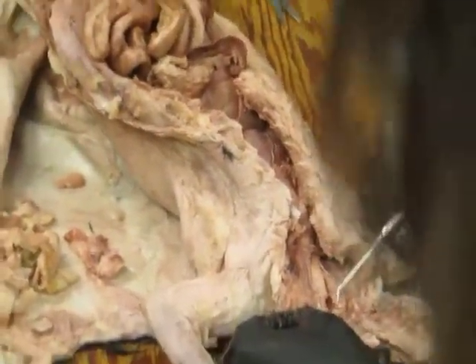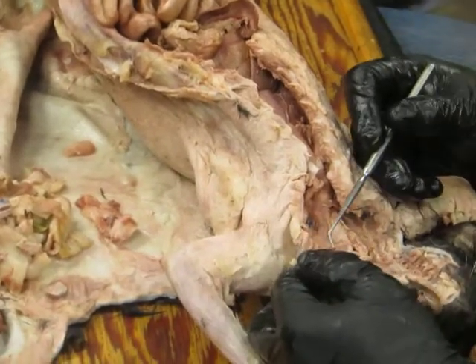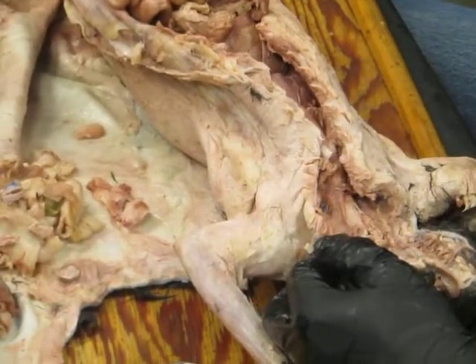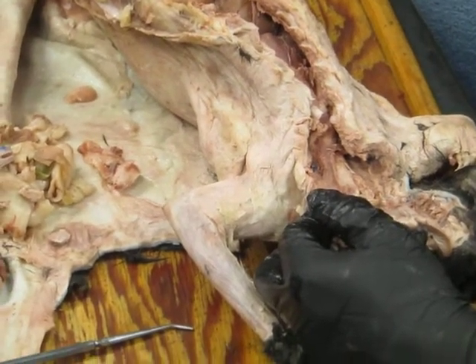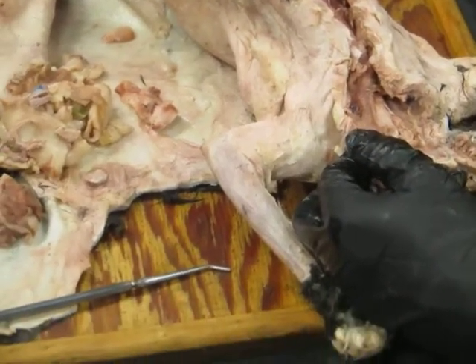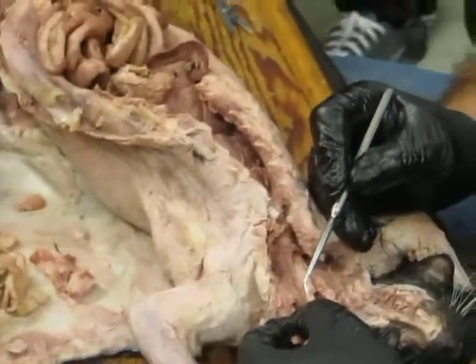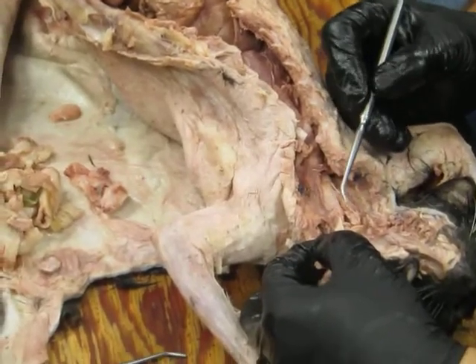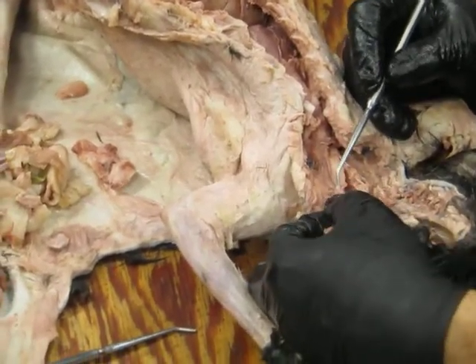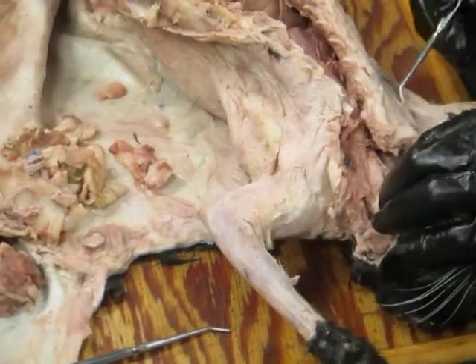And you won't be able to see this, but I'll just tell you there's a big shield-shaped one, that's the thyroid cartilage, that's the Adam's apple cartilage, and that's where we saw muscles attaching. Do you remember the sternothyroid, thyrohyoid? And that's this big cartilage right here. Okay. And then there's a ring-shaped cartilage below that called the cricoid cartilage, and some other little cartilages called the arytenoids.